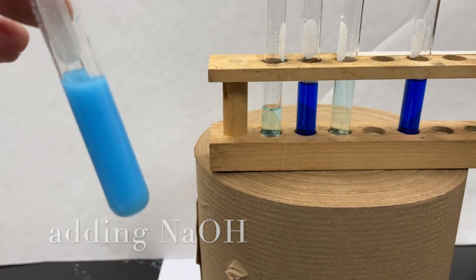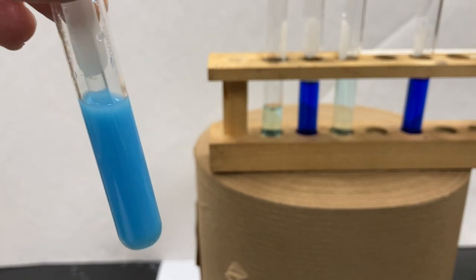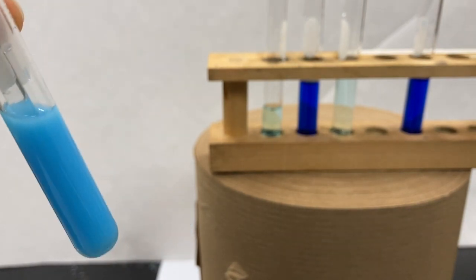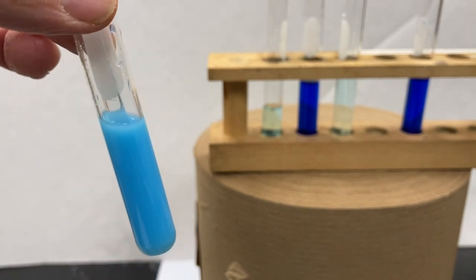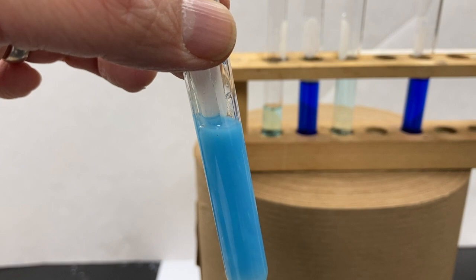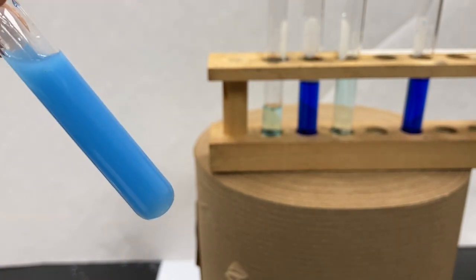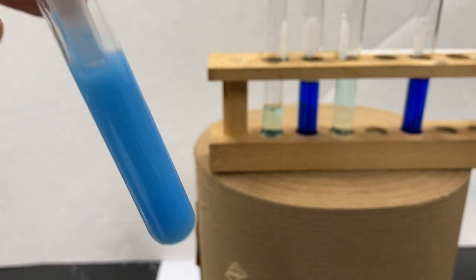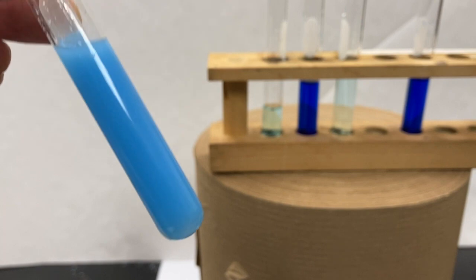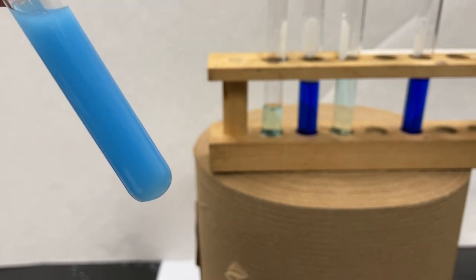Remember, cloudiness is a sign of precipitation. So I wonder if we can get this back to be translucent like the HCl did. Let's see. Nope. I added a fair amount, and this solution is going to stay as an opaque, cloudy, light blue solution.